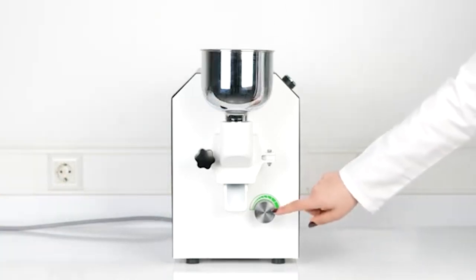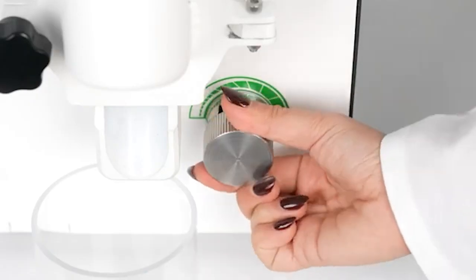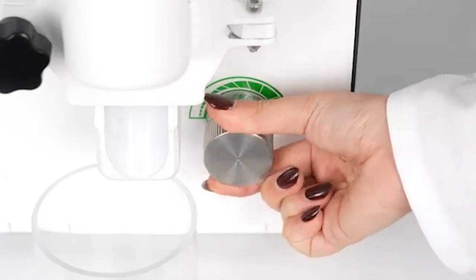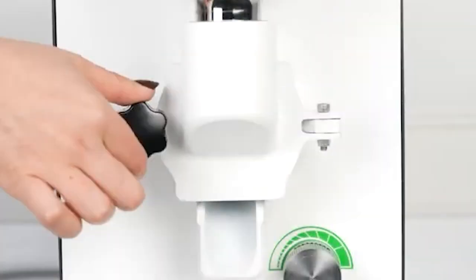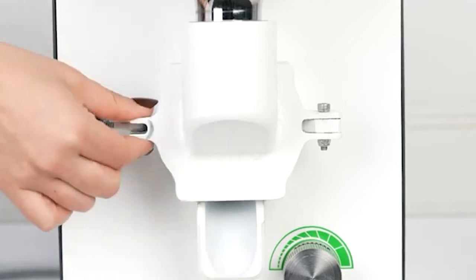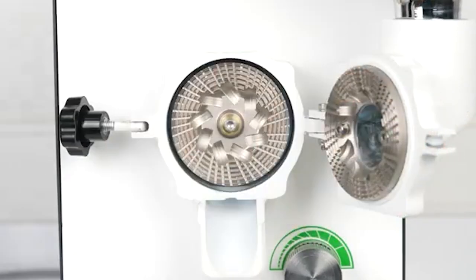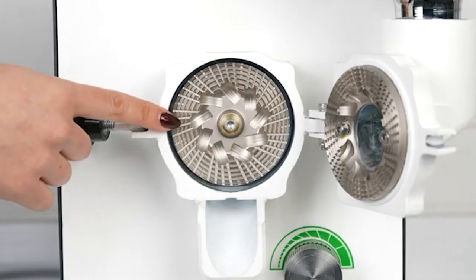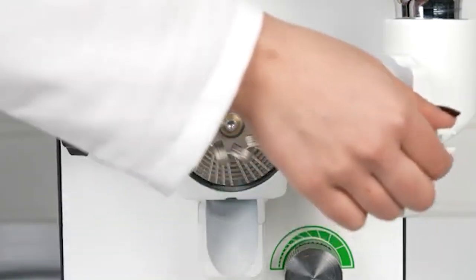The crushing gear distance adjustment button allows the adjustment of the distance between crushing gears. The grinding cell is the unit where grinding takes place with the crushing gears.